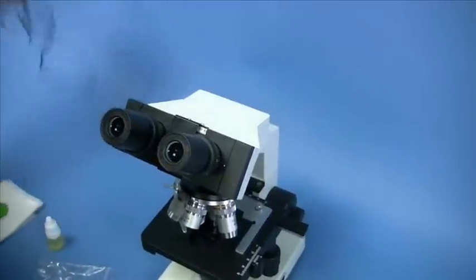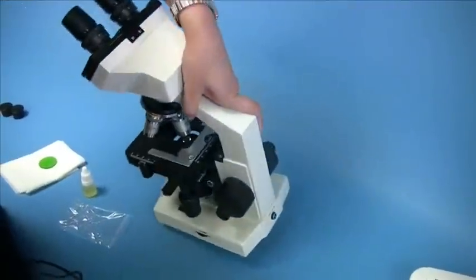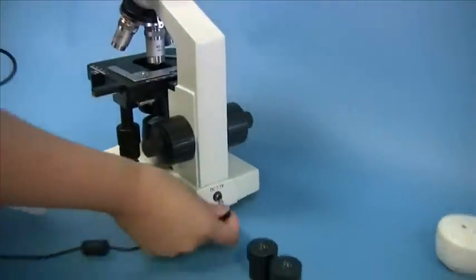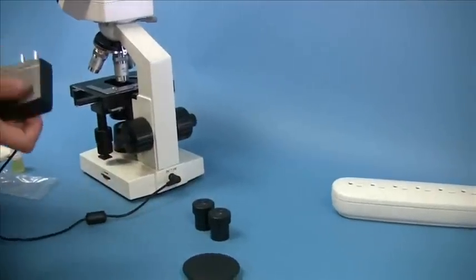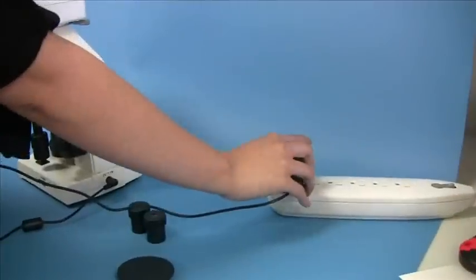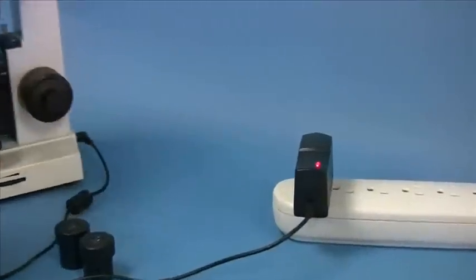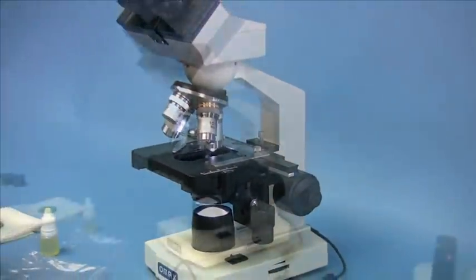Now take the power cord and plug the power cord in the power socket at the back of the microscope and in the power outlet. Turn the switch on, and the assembly of the microscope is now complete.